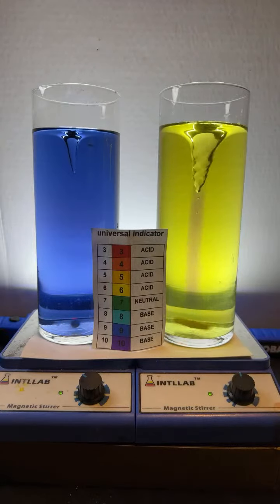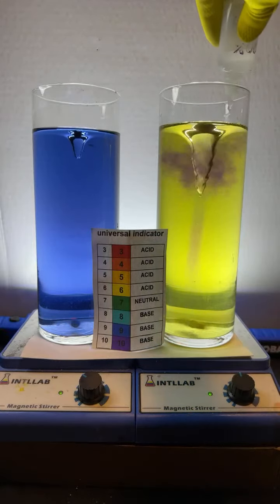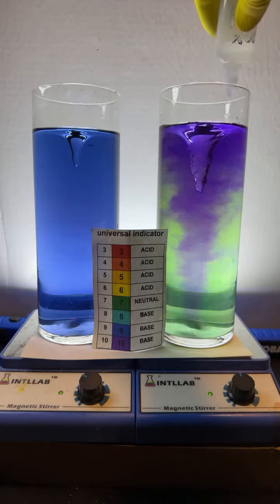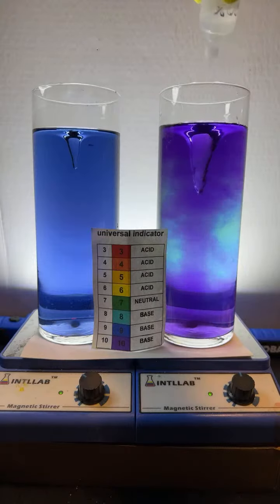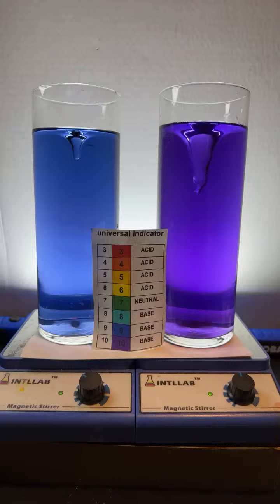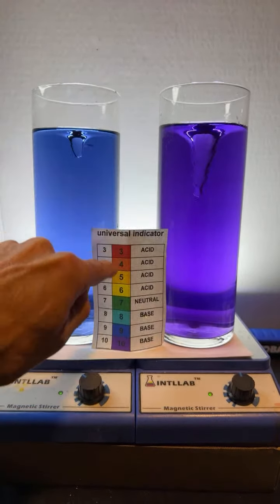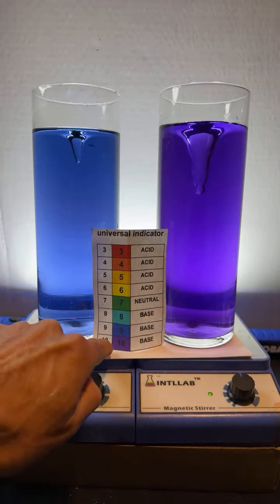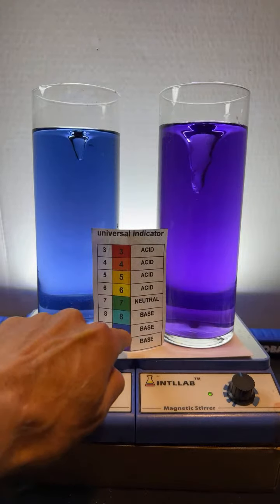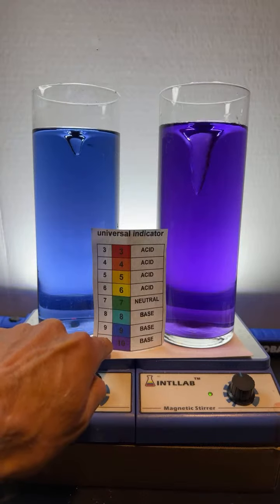Base 10, you got it, Viking 3. So I'm going to go ahead and add a bunch of base over here on the right. And you can see as I do that, the color shifts to blue and violet. Middle as in halfway between the edge of the glass and the center. You got it. Let me explain this first. So notice I added a bunch of base and the color went to violet. So we see a pH of 10. That's very basic. Okay? So pH 10 is highly basic or alkaline.